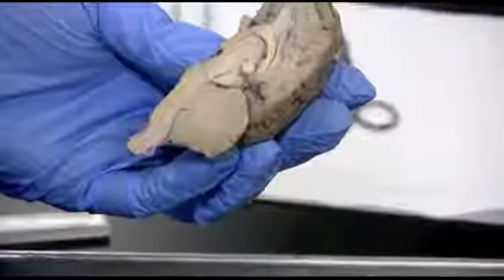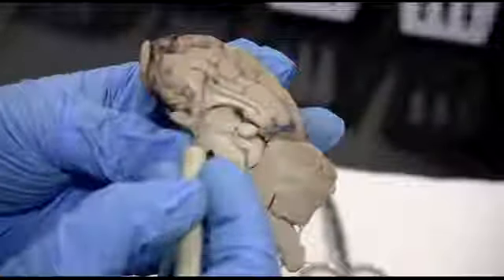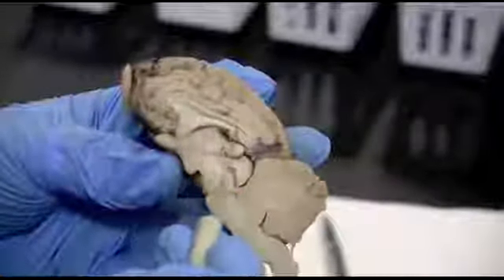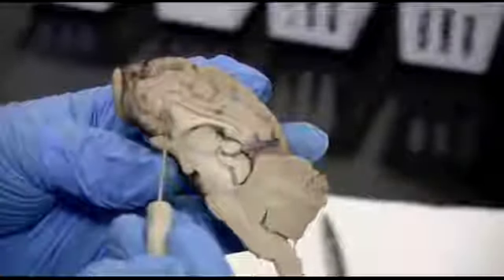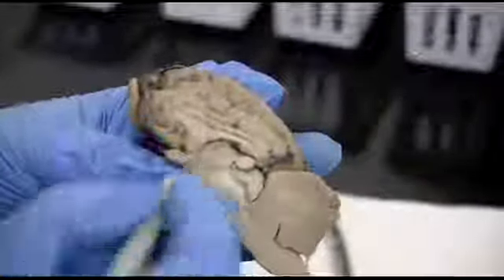I'm going to put one down for a moment so we can see a really good landmark in the middle here. This is the corpus callosum, this little arch that comes up here, and this loop. If we follow it like a circle, the inferior portion is the fornix down here, but this top is the corpus callosum, those fibers that connect the 2 cerebral hemispheres.